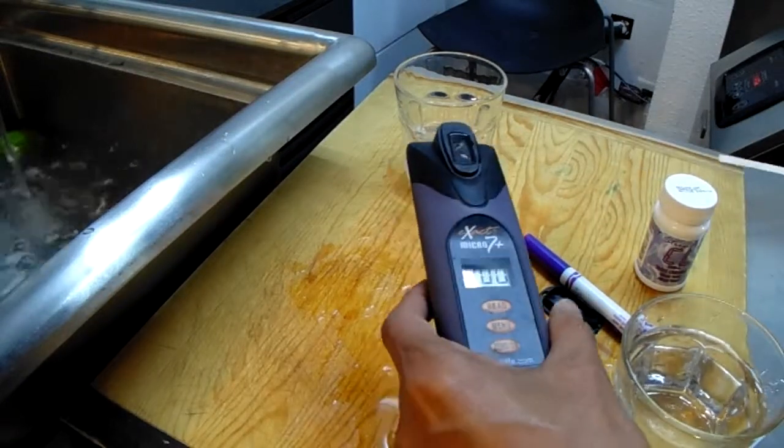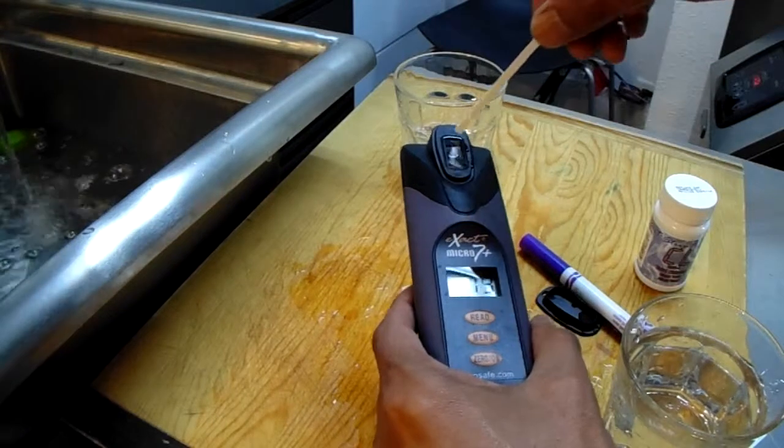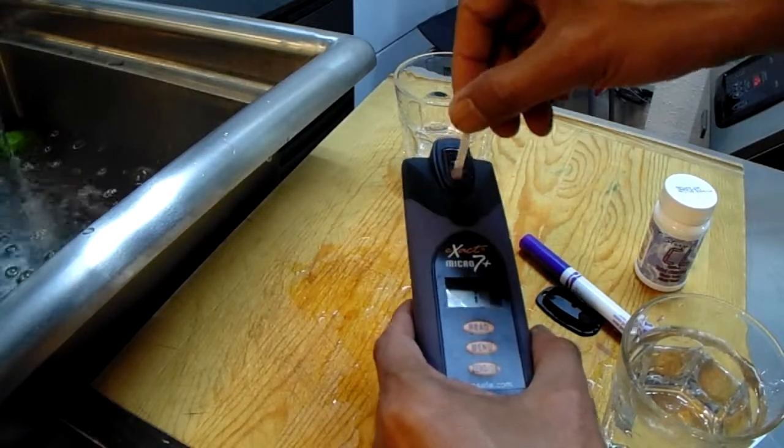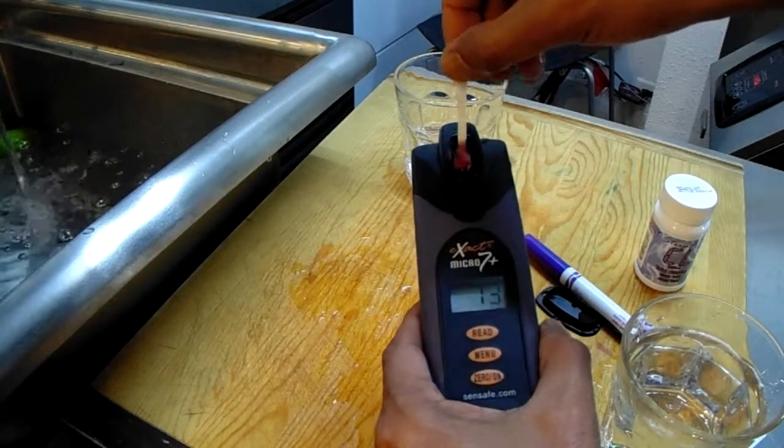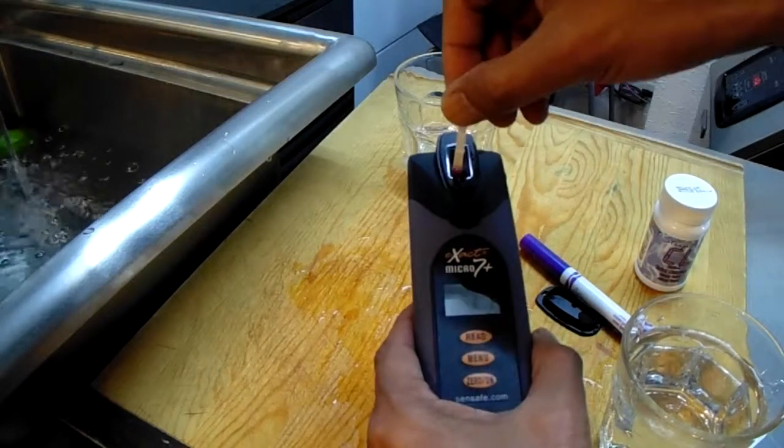We'll press the read symbol. Then we'll move the reagent in the water as in the instructions. This will take about 20 seconds.